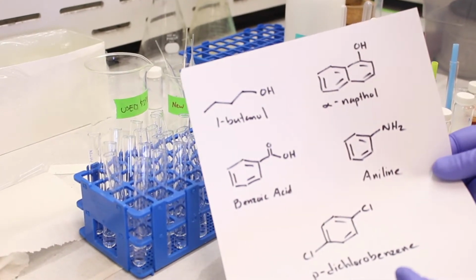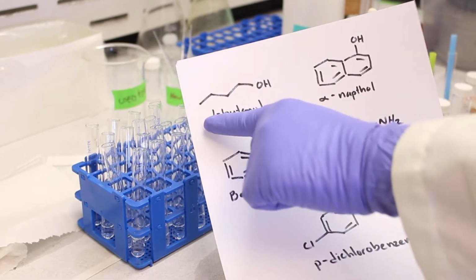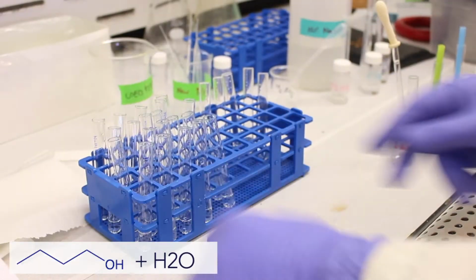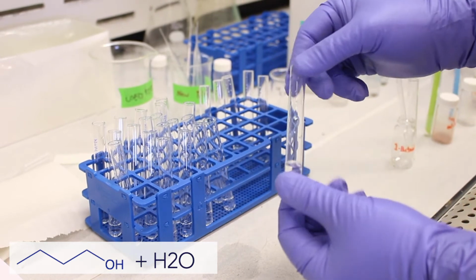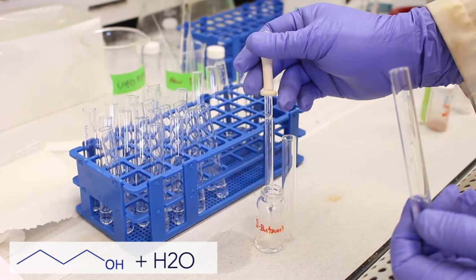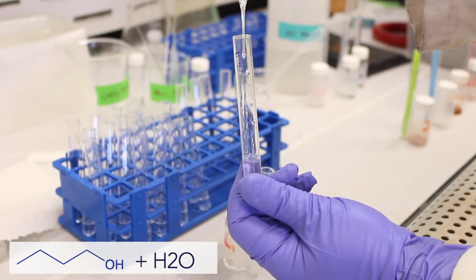So the first compound we're going to start with is butanol. So 1-butanol actually has a carbon-oxygen ratio of 4 to 1. So there are 4 carbons, 1, 2, 3, 4, and 1 oxygen. So we would assume that butanol is insoluble in water. So if we take a vial of water, and this is how it's done normally in the lab, you take a test tube of water, it's about 1 milliliter, and then you take your known, in this case butanol, and you place a few drops inside the test tube and observe if it dissolves. So place a few drops.